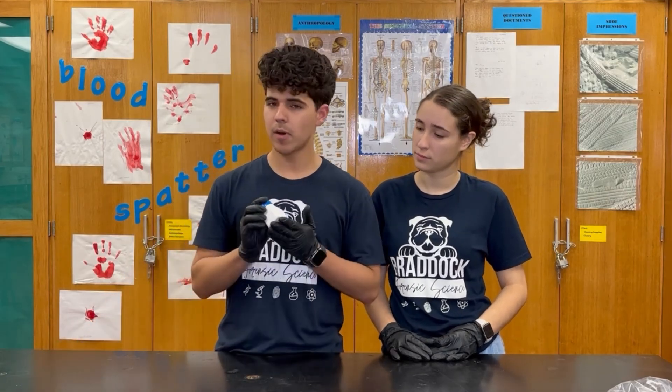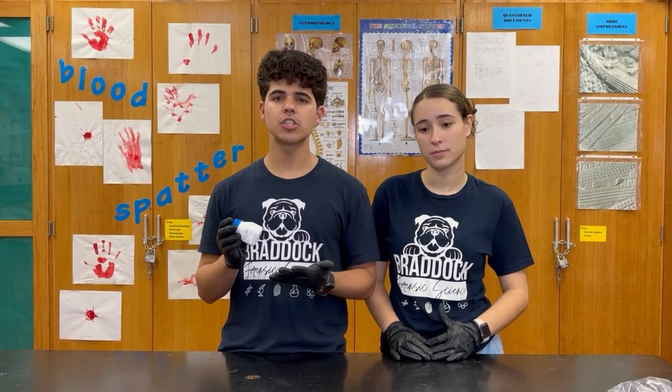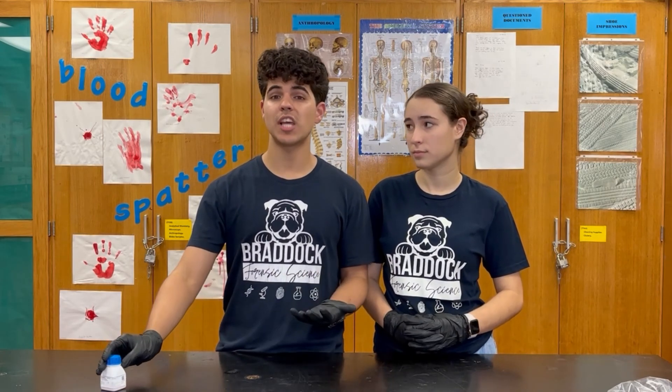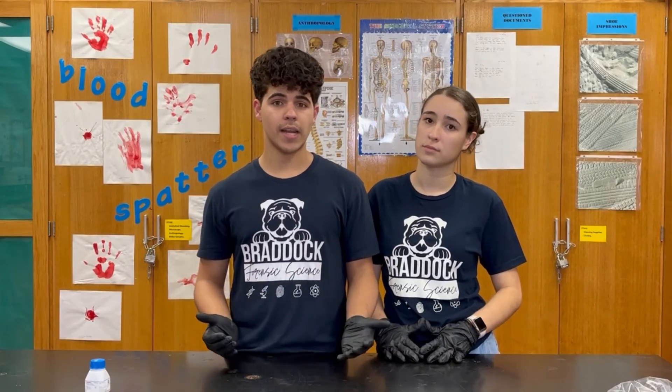In addition to this, ninhydrin is not used in its pure form. This powder that I have right here is ninhydrin, but we're going to mix it with acetone. This solvent is going to reduce the concentration, making it safer to handle. However, the presence of acetone in this process is going to damage the ink of the document that we're analyzing.